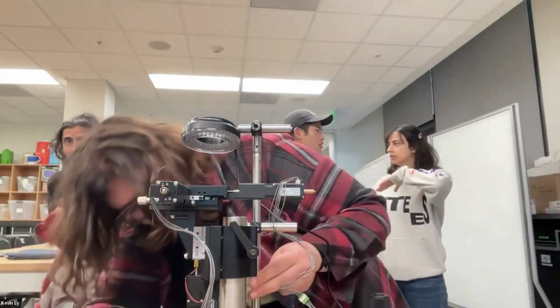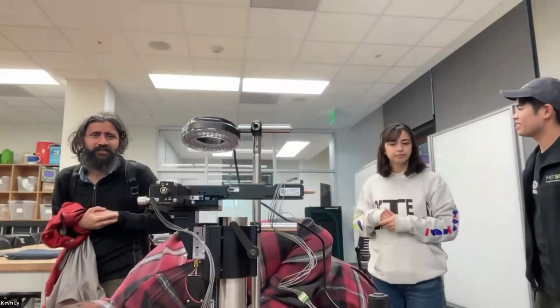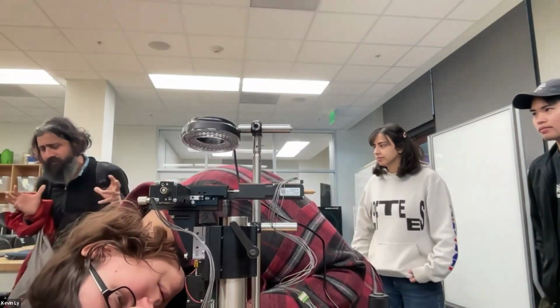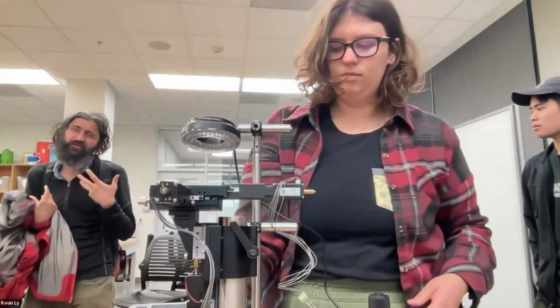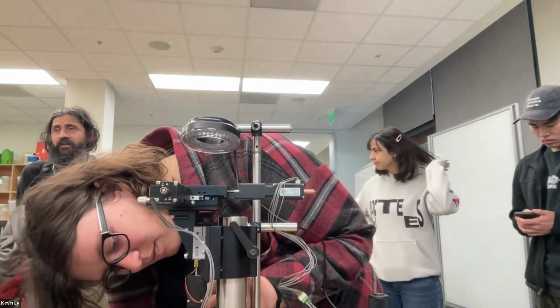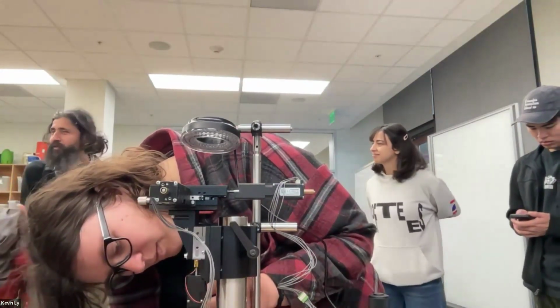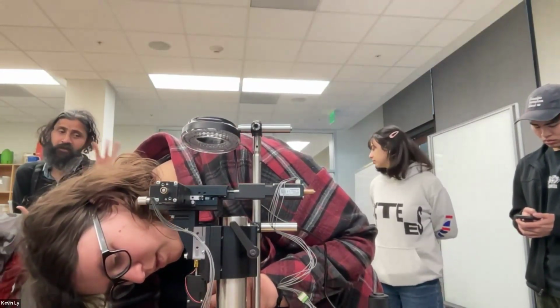Sorry, I know you gotta go, but what is just the bulk of that 3 to 4K? Is it just all of it adds up? Yes, stages. SQUID has a BOM. Gotcha. And that BOM has expanded, so when I'm saying 3-4K, that has fluorescence included in it, filters are super expensive. If somebody can just figure out to make cheap filters, like high quality chroma filters, you would give chroma a run for their money, quite literally. The laptop always ends up being a big chunk, like 1K or so, because we do some ML models on them.